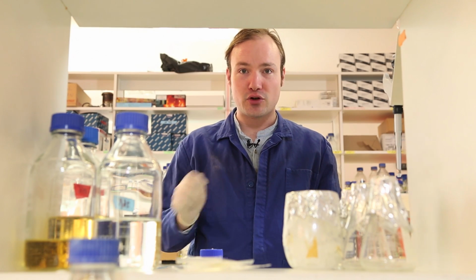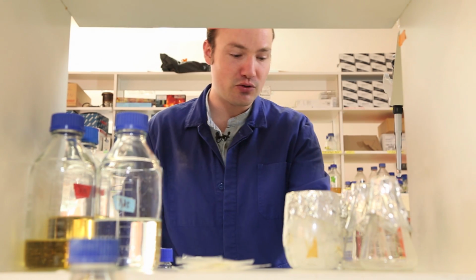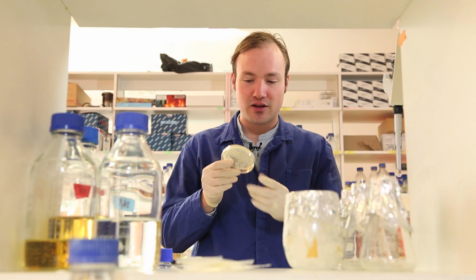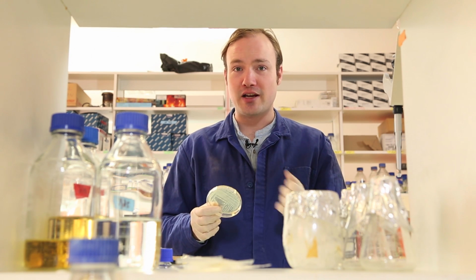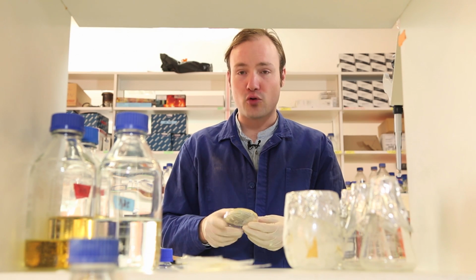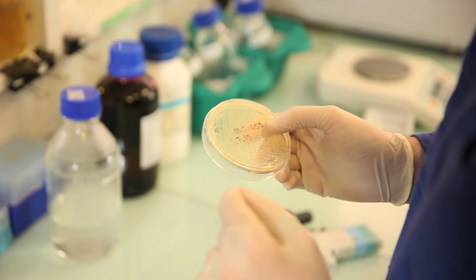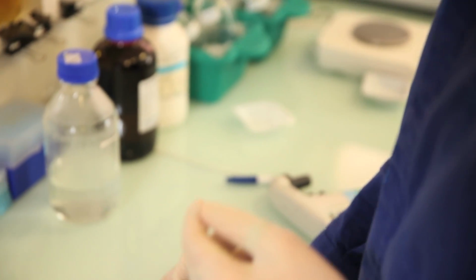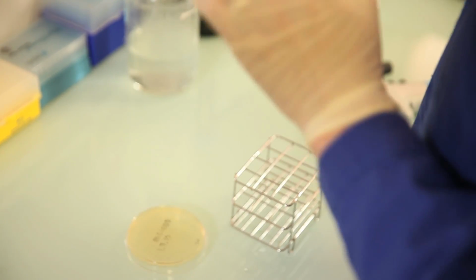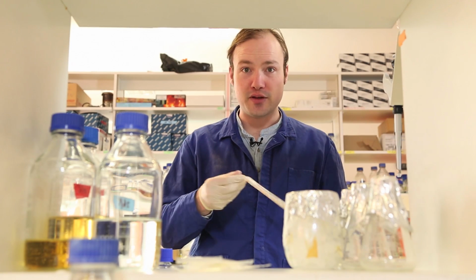Now we're going to start the culture of cells that we're going to actually be making competent. For this, I have a plate of MG1655. You might want to use NEB Turbo or DH5 alpha or some other cloning strain. This is just a wild type strain of E. coli, and it's what I happen to have ready around the lab. We're going to start a 5 ml culture of E. coli in LB media.